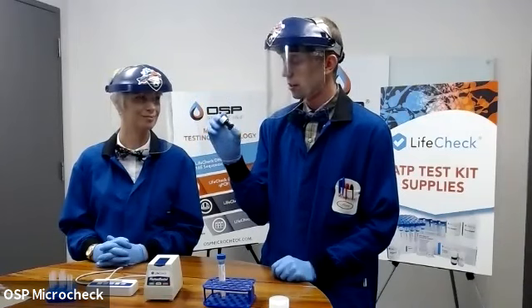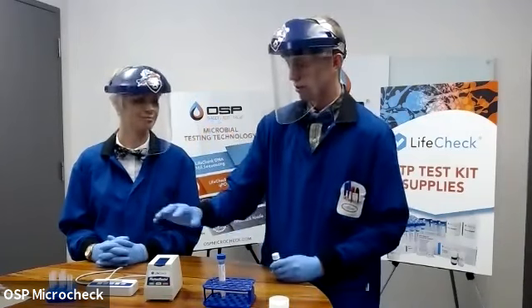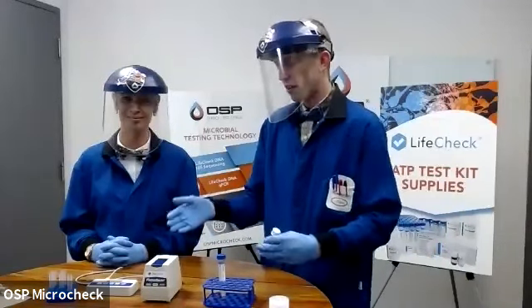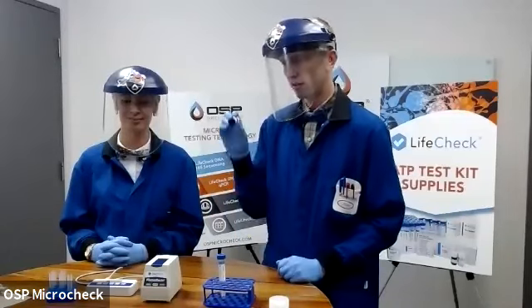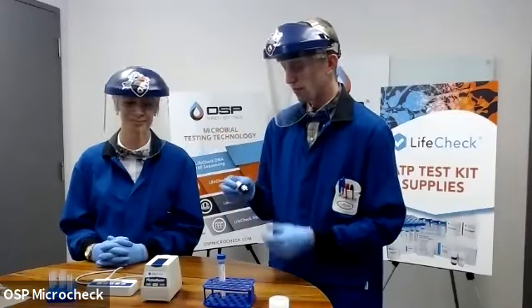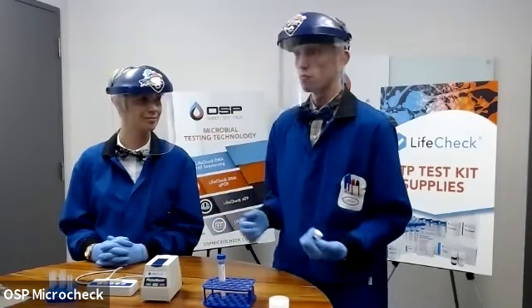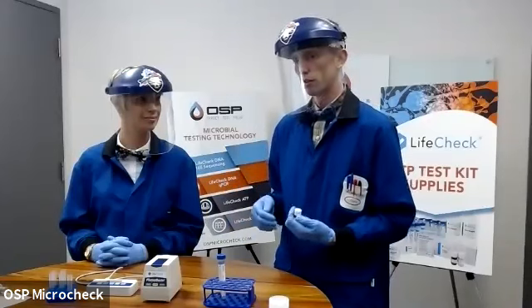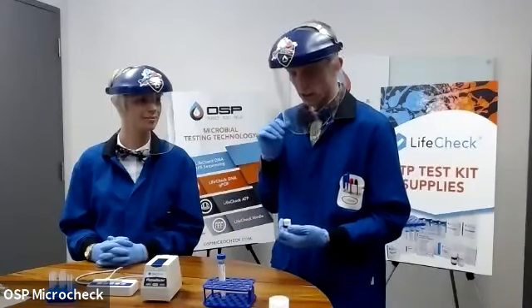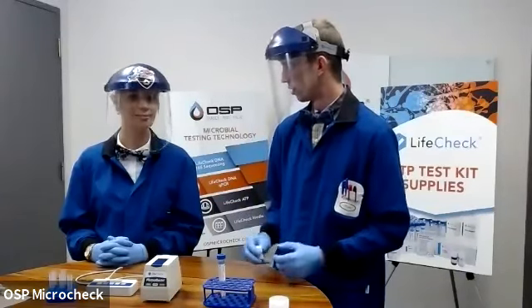And when this meets up with ATP, it actually produces light. So this box works in kind of like a reverse flashlight mode, where instead of giving off light, it reads the amount of light that the reaction between the luciferase enzyme and the ATP happens. If you consider that the more light that is produced means that there's more ATP. More ATP would mean that there is a higher microbial load in your sample being tested. That's where we're able to backtrack from an RLU value all the way up to a number of microbes per unit volume.